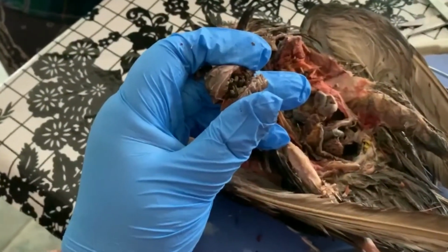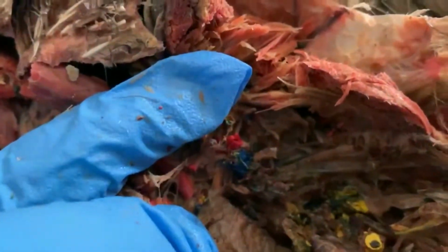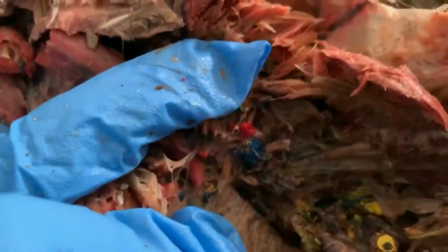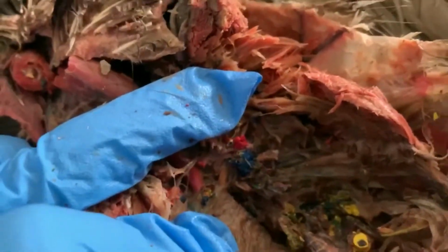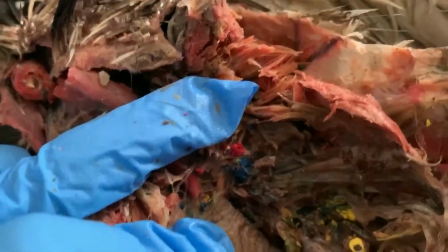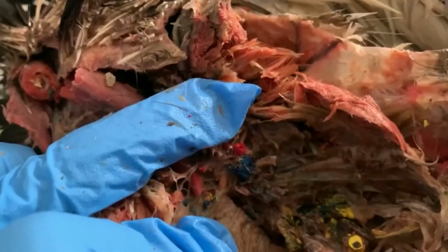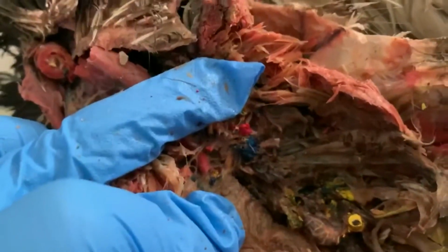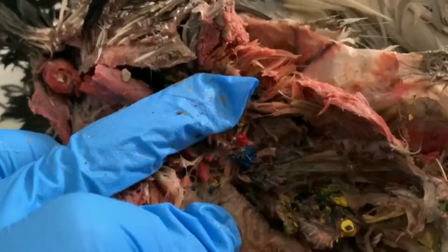All right, so it was really hard to isolate the lungs on this specimen. You can see where I've made a cut right there. That actually ended up cutting through the lungs. The lungs are almost attached to the ribs themselves, at least towards the back, and have a variety of different little air sacs that can independently inflate.